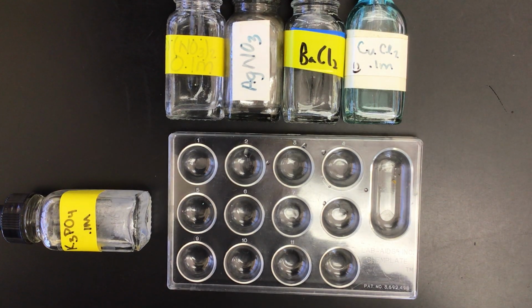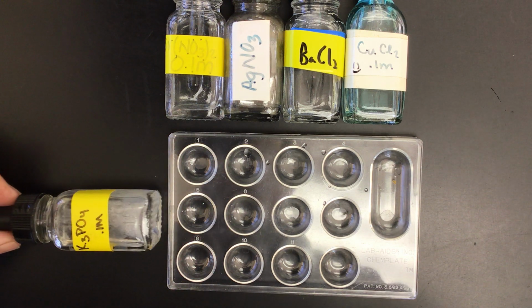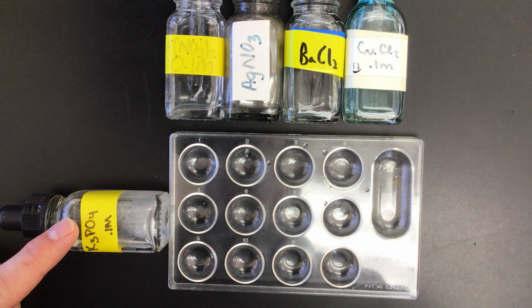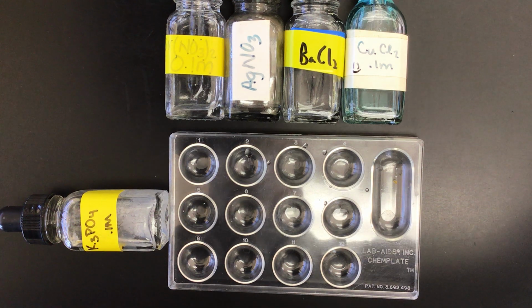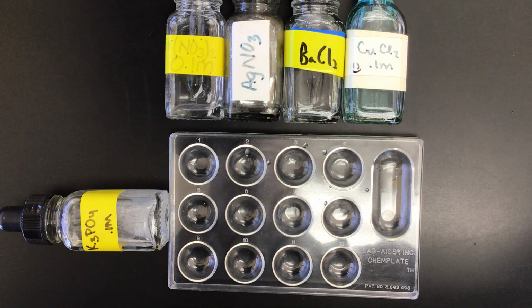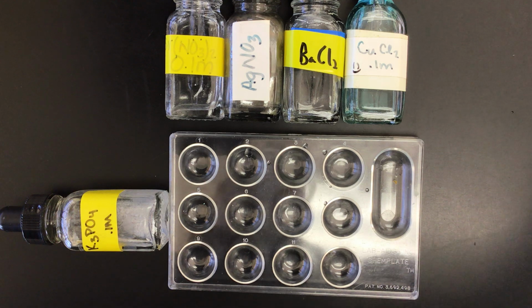What we're going to do is go through that second row of our precipitation lab. I've got the bottles turned sideways so you know what I'm adding here. On the vertical here, I guess we'd call it, this is our potassium phosphate solution, 0.1 molar. And all these solutions are 0.1 molar, which goes along with our table of solubility. Our table of solubility is a good indication about when a precipitate will form, and we're going to go with that.